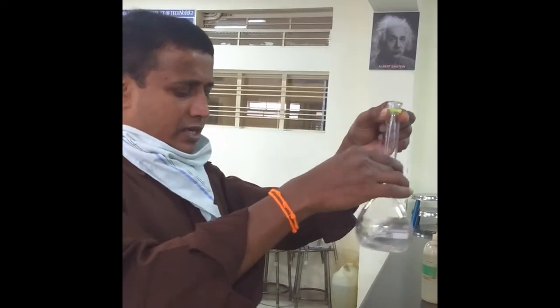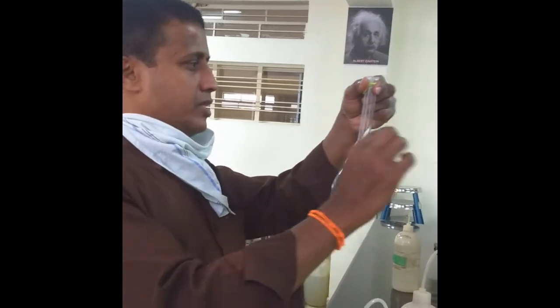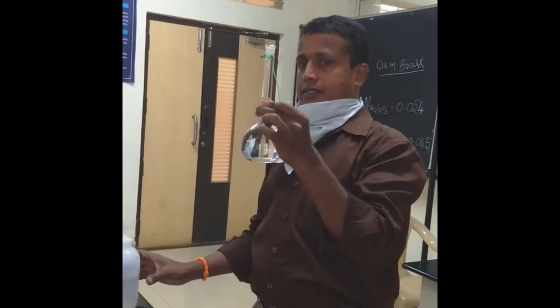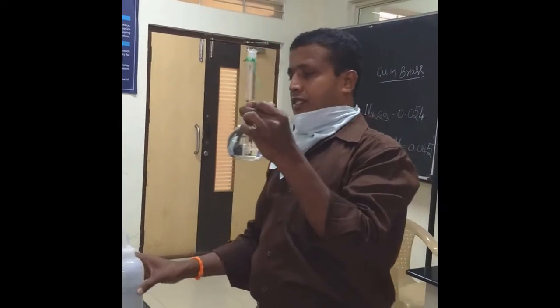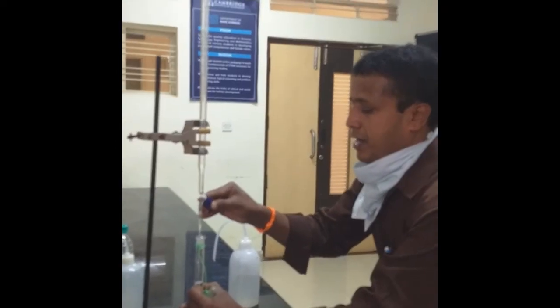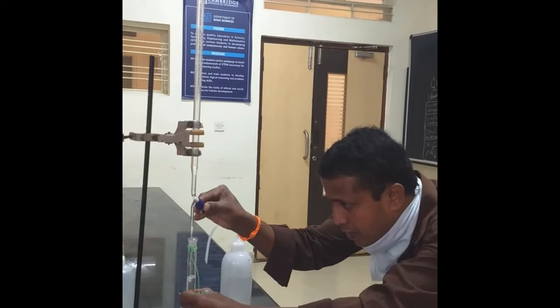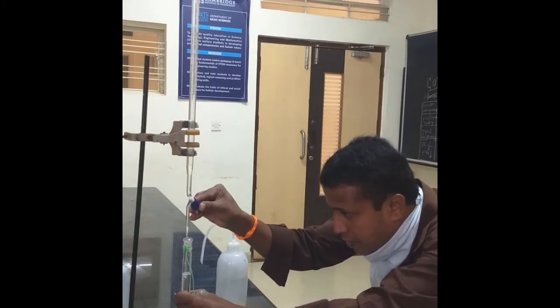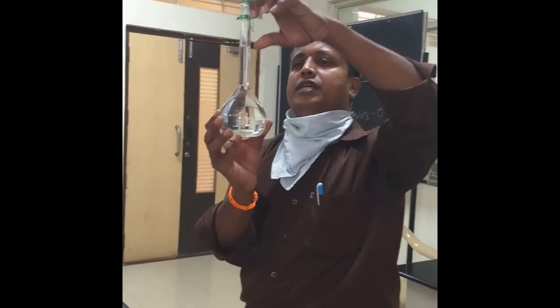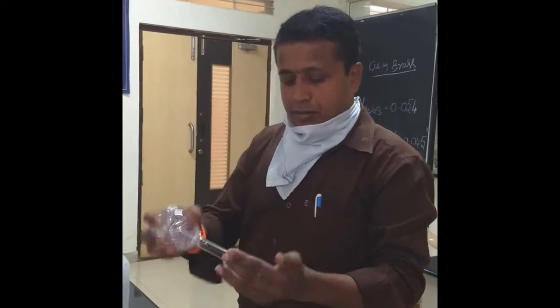Once ensuring that all crystals are dissolved, you need to add distilled water up to the stem, and the remaining portion you need to make up with the help of a burette. It is now made up to the mark. The lower meniscus should coincide with the line. Now shake it well for uniform concentration by putting on the stopper.